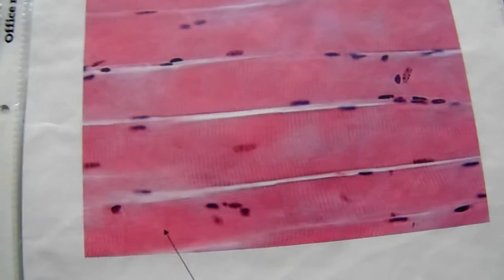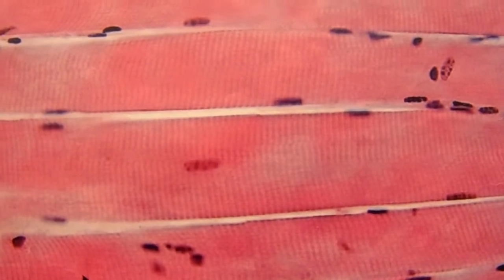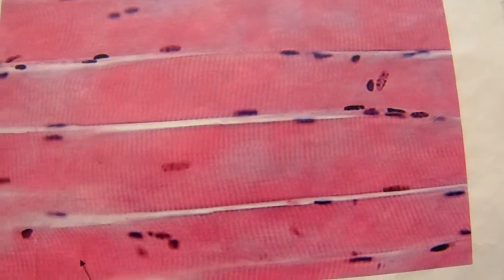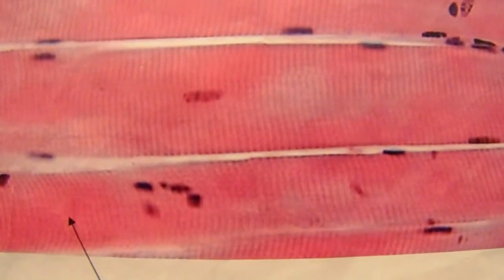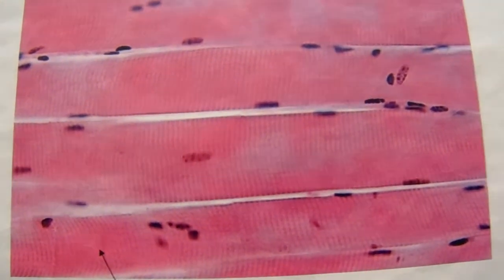Okay, we have three types of muscle in the human body, and this type is skeletal muscle. 40% of my body is made of these skeletal muscles. That's what I look like under a microscope. They have multiple nuclei. See the white line? That's the cell membrane stacked on top of each other. These skeletal muscle cells are fibers. They run the length of the muscle. So my biceps brachii, they run about 3 inches. And those striations, the vertical lines, they help us move. And the white horizontal line is the cell membranes stacked on top of each other. Okay, so that's a bunch of cells there. Only cell in the human body that has more than one nucleus. Skeletal muscle cells.